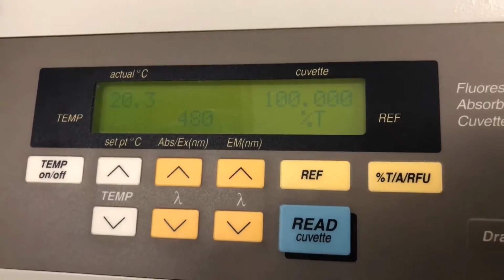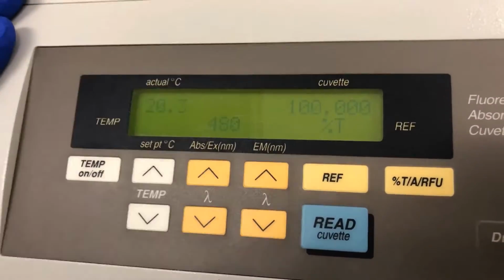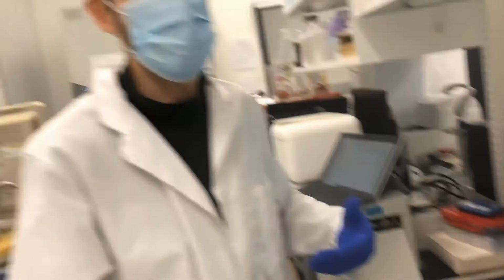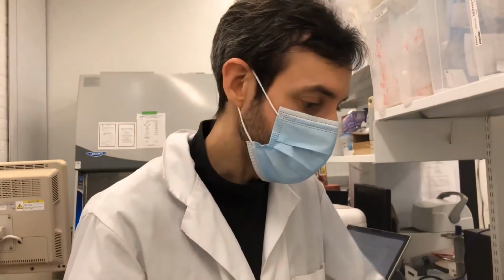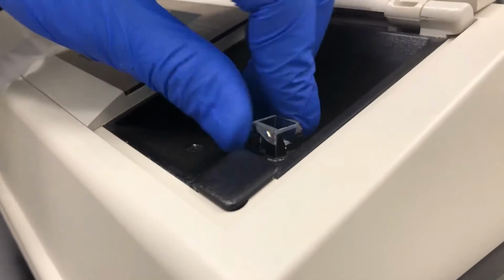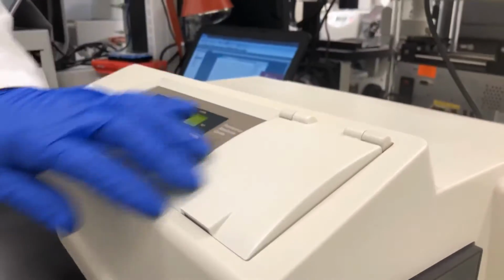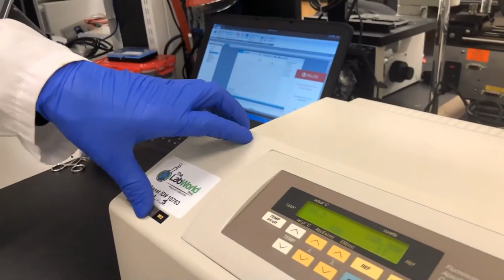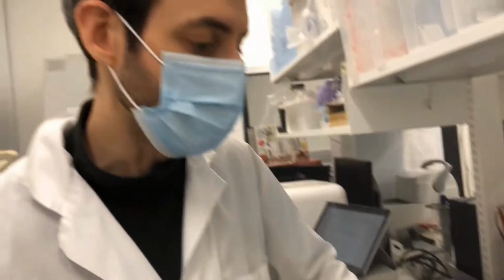So we're just going to start here with transmittance and using the cuvette holder. And this is a great place to start if you want to get some really accurate results with your absorbance readings or transmittance readings. So in this side, I have my quartz cuvette filled up with some water. Now, you can reference it, or you can just use the pre-referenced or internal reference of the machine.